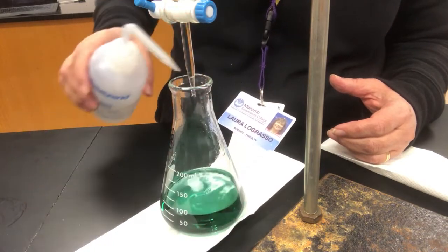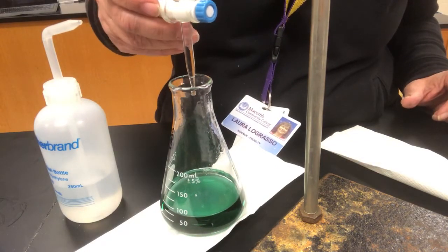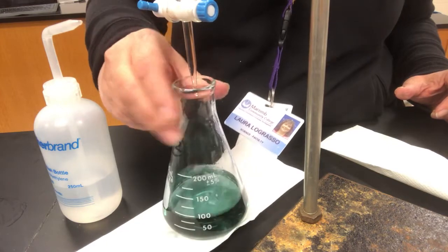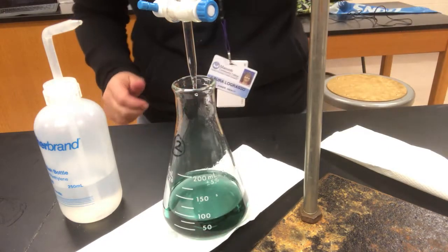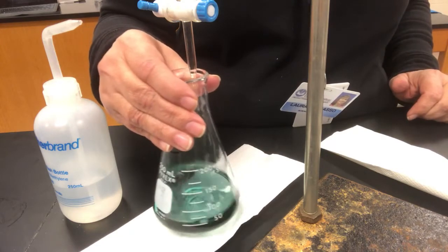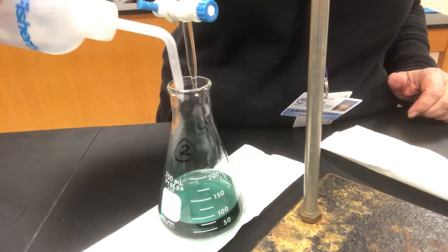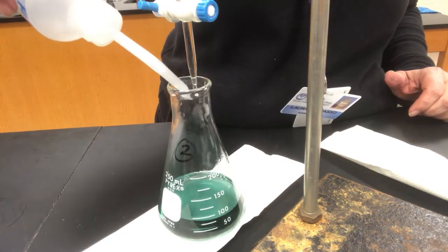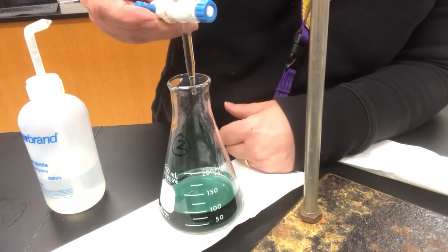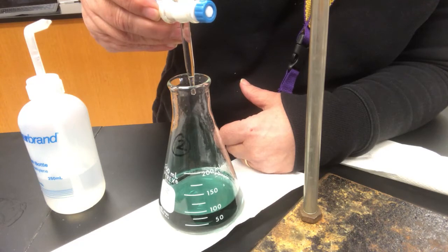I feel like it's close. I can see the purple kind of appearing when the drops go in now. Yeah, oh, that's close, close, close, close. So you see this changed a little bit of the shade here. Now I want it to be blue-gray. It's still got a little green tinge to it, so I'm going to try and just add a drop and edge that green out of there. So again, I've got to be super careful. This thing's touchy.